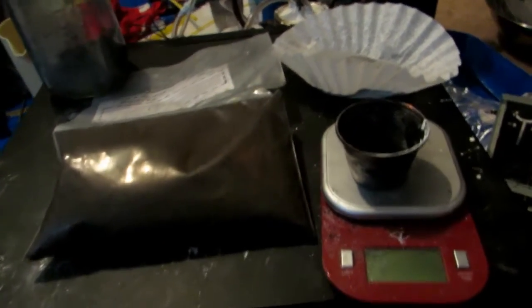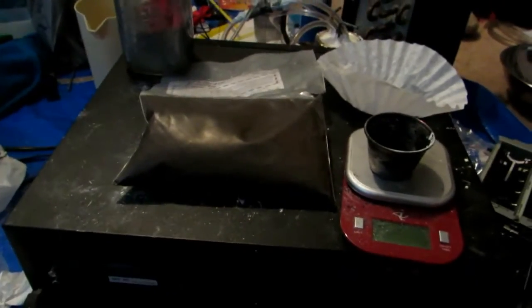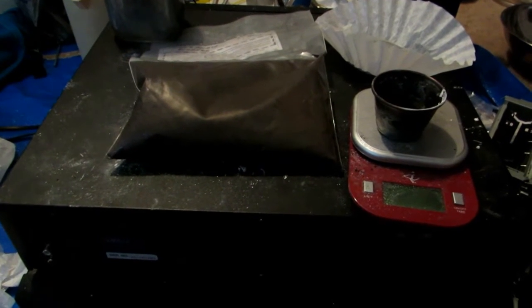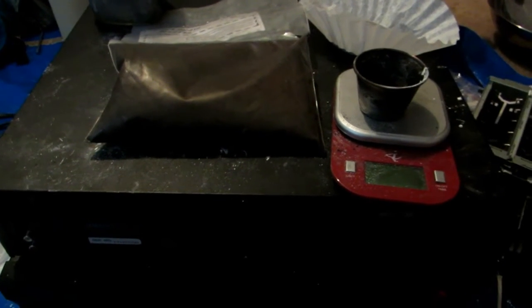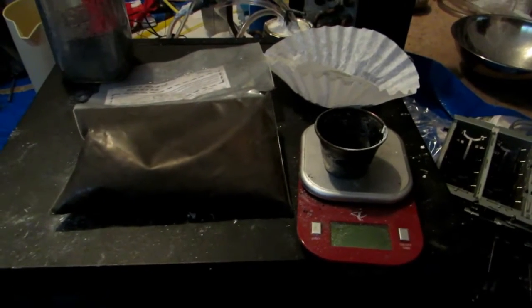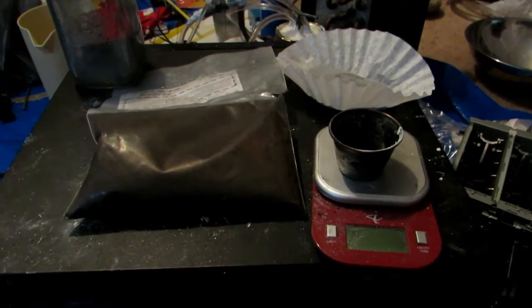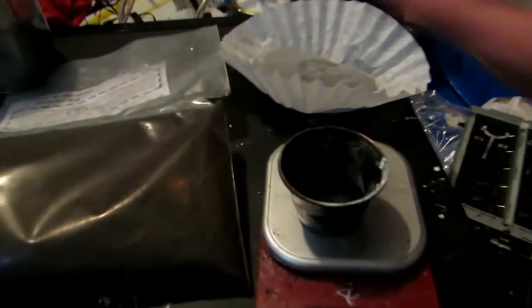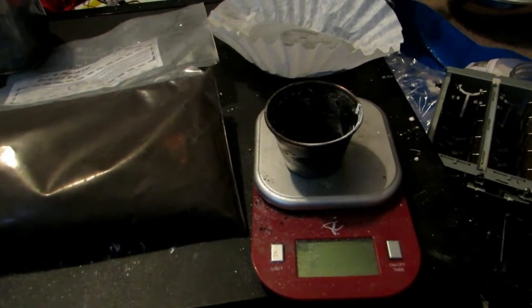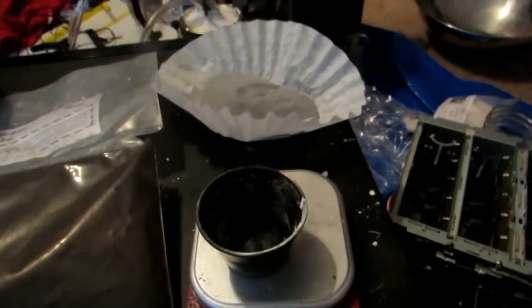This stuff works excellently as a reducing agent for manganese dioxide because it doesn't burn so fast that all the manganese vaporizes, but it's also still fine enough to sustain combustion. Today we are going to be reattempting the manganese video using these two things. We'll first be taking the aluminum powder — I think I'll weigh out approximately 20 grams of this coarse aluminum powder.